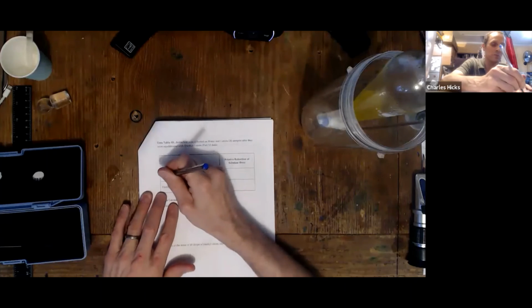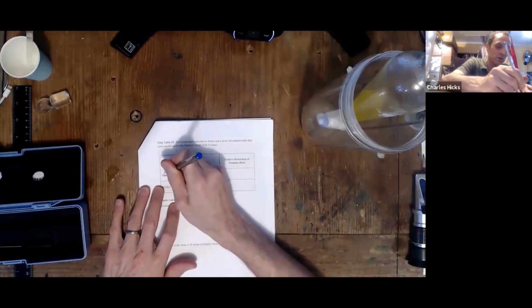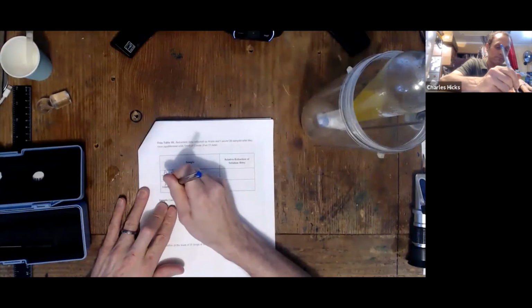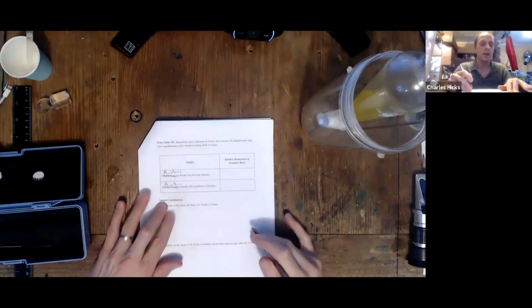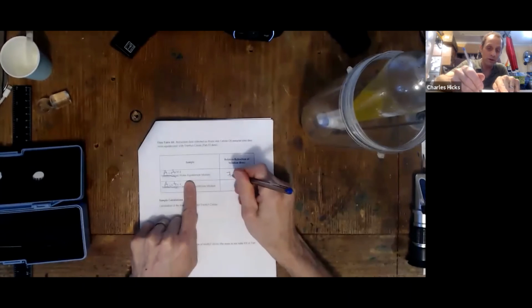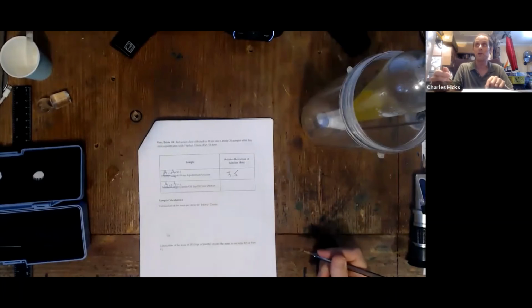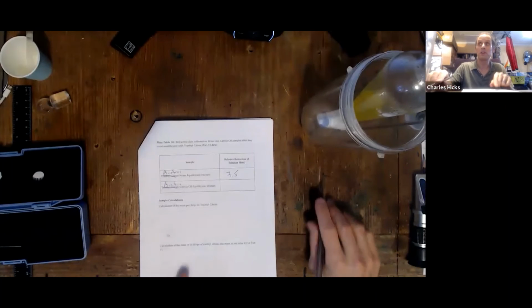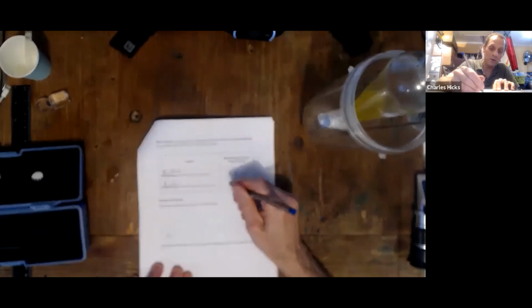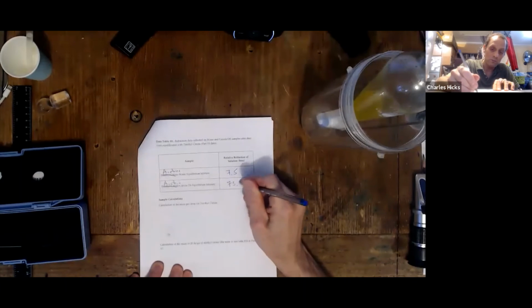And I was doing my experiment for demo purposes with acetone. This experiment works very well with acetone also. And I just collected a refraction in the water layer. I saw 7.5 as the value. And I'm going to repeat the same thing in the oil layer. When I do repeat in the oil layer, I'm going to find a value of 73.8.